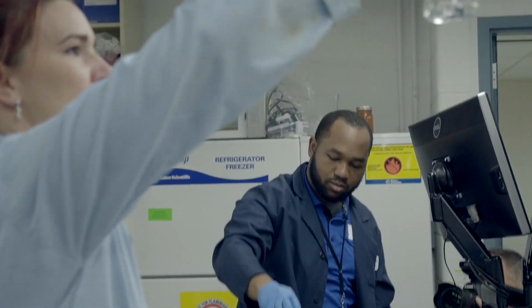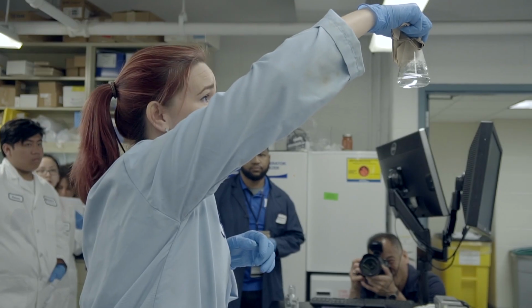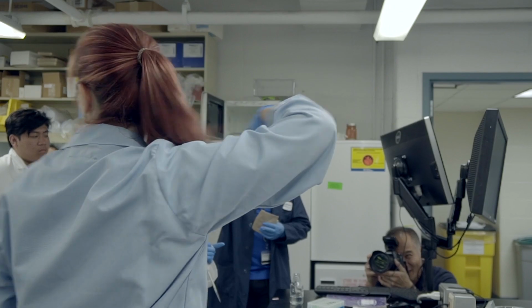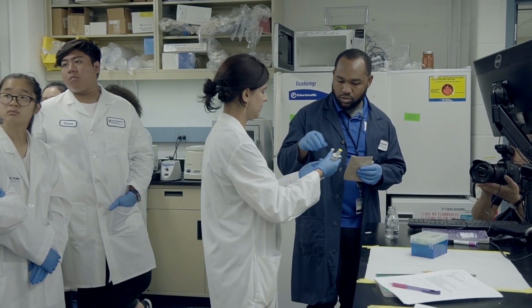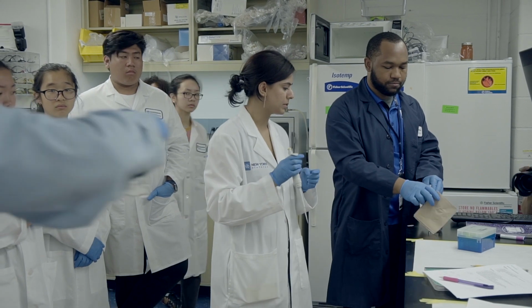And you're looking for, sometimes you'll see some little pieces that look like gel floating in there. And if you see that, you heat it just a little more. But this looks clear, but it's a little thick. So hopefully you guys can see, it's clear but thick. And if you saw stuff floating in it, which I assume Mike saw after he did the first heating, you just heat it a little bit more.